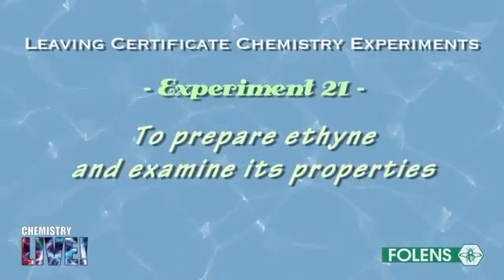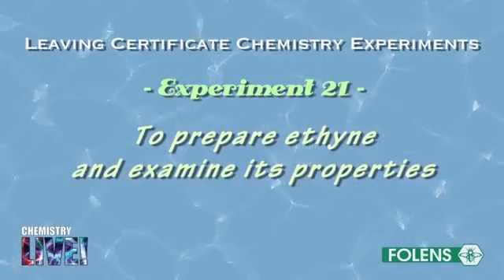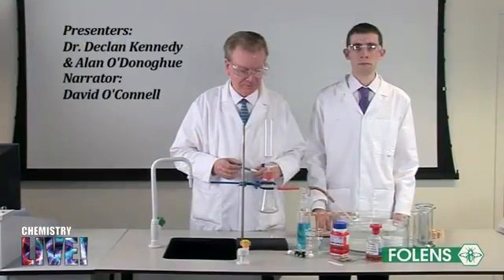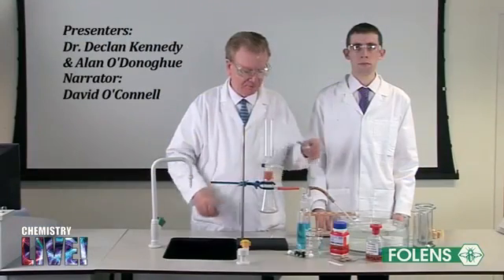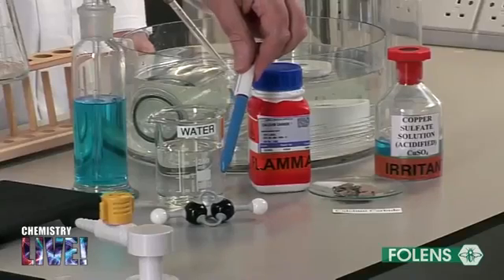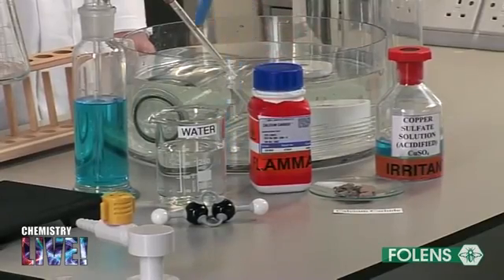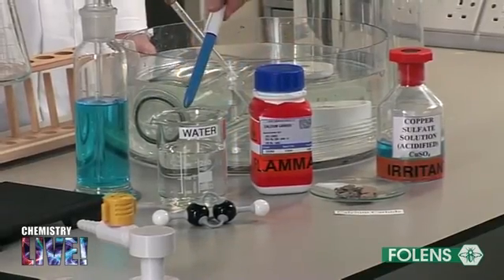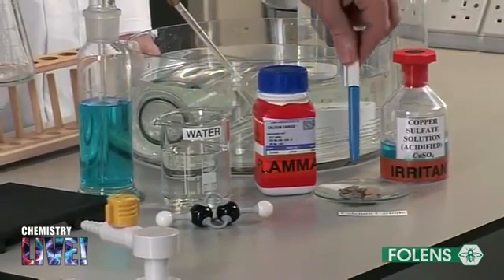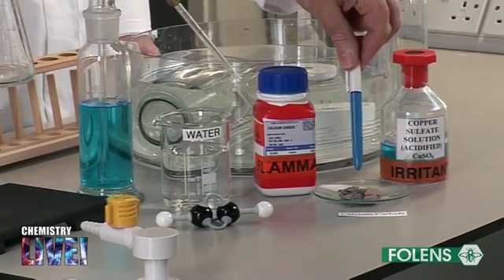Experiment to prepare ethyne and examine its properties. Ethyne, C2H2, is prepared by the reaction of water with a substance called calcium carbide, CaC2.